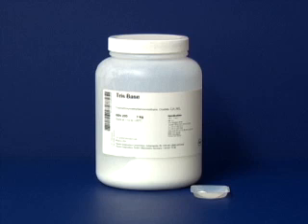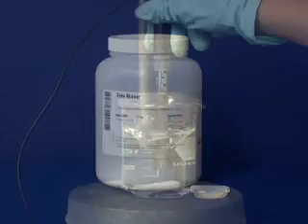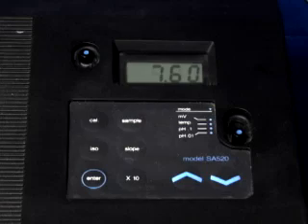Before taking a measurement, make sure that your sample buffer is at the same temperature you'll be using in your experiments, because pH is temperature dependent. Rinse and blot the probe and place it into the buffer. Wait for the display to stabilize and record the pH. Correct buffer preparation and pH meter technique are essential to ensure that your proteins and other sensitive chemicals live long functional lives.